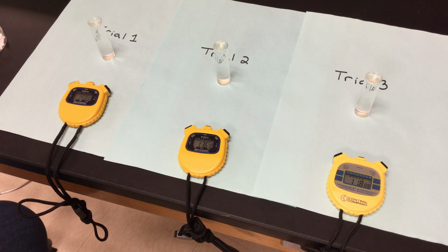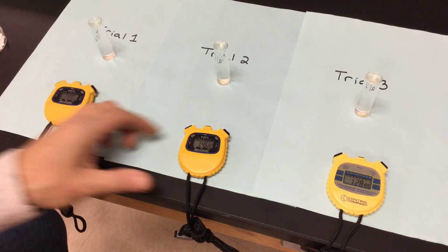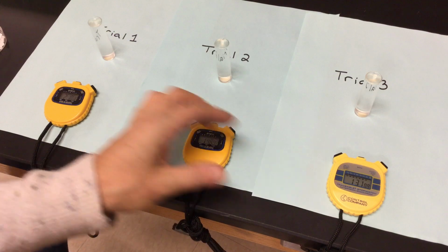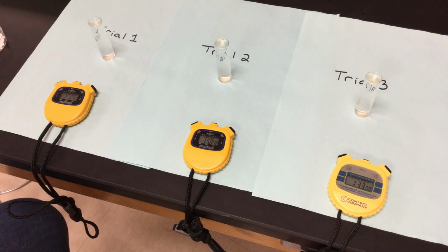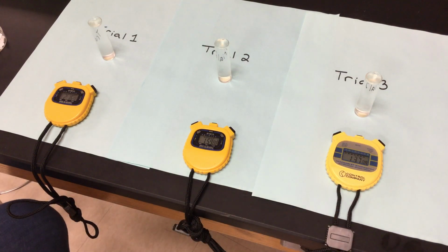If it is not working, maybe my enzyme's not working. Well, why is my enzyme not working? Well, we are in a pH of 3 right now. So my first one, we're up to about 2 minutes. 4 minutes is my maximum. 1.48, 1.31 is what I have. All of these are my pH of 3. And we'll keep letting them go. We're keeping an eye on them. We want to see if they kind of float up to the top.